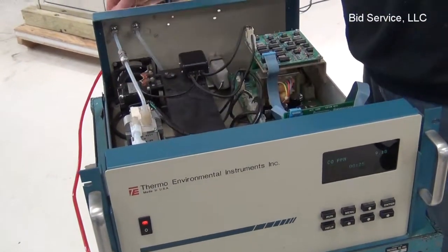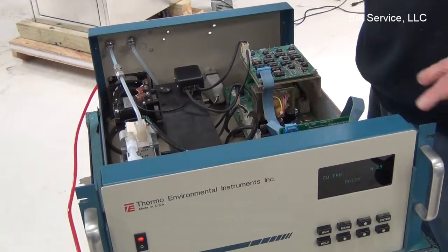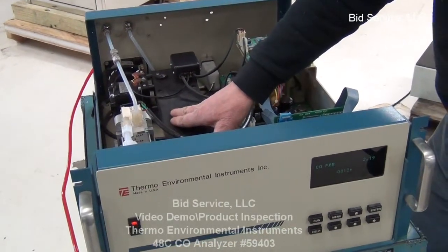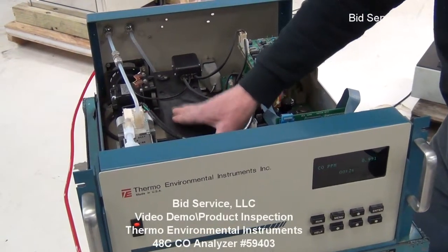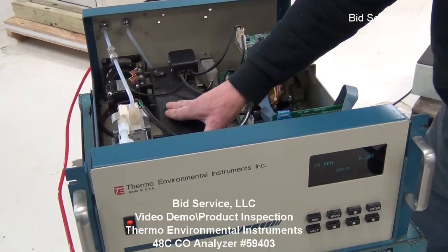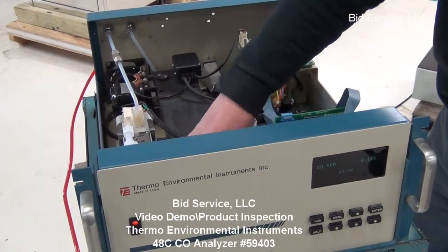There is an external exhaust that is normally exhausted outside the area that the instrument is operating in. Also, periodically, the software has the capability of scrubbing the inside using the scrubber, changing any residue carbon monoxide into carbon dioxide, just to keep the system pure for the next measurement.